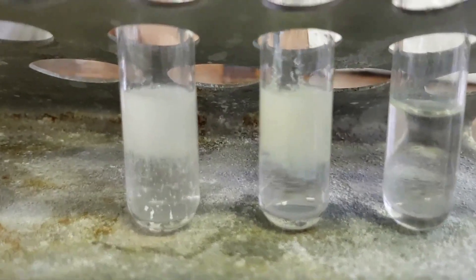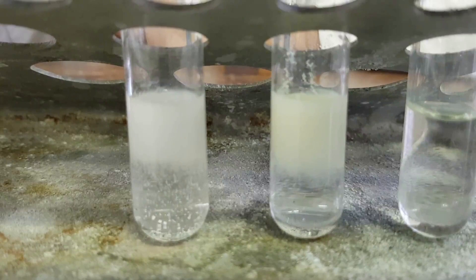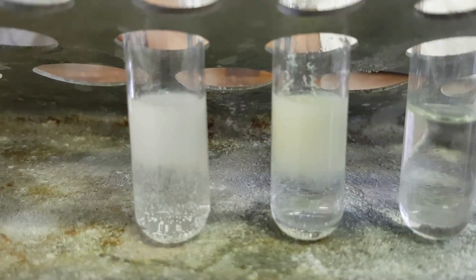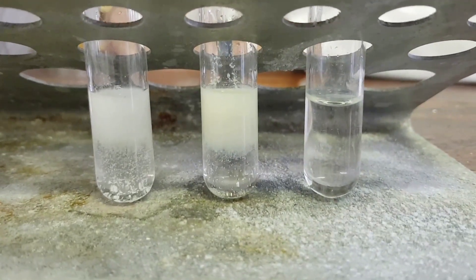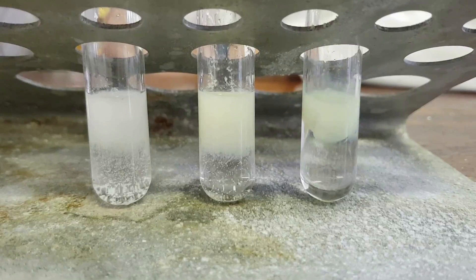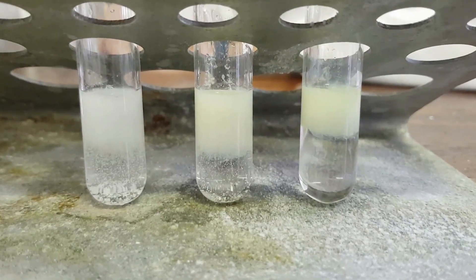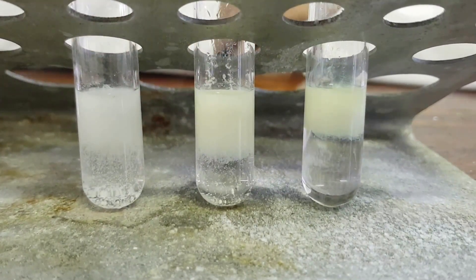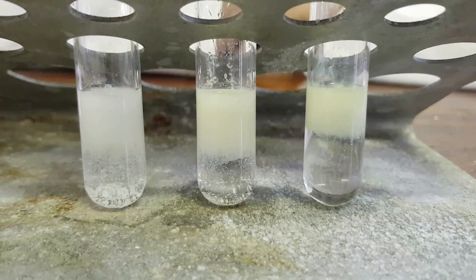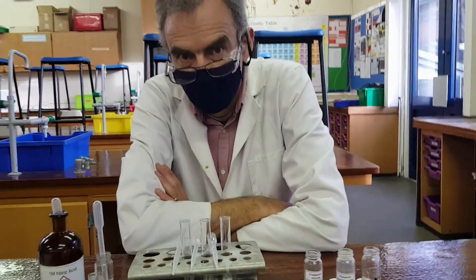Now for the bromide. When compared, it is obvious the bromide is a creamier colour. If you saw the bromide in isolation it would be quite difficult to distinguish from white, but next to the chloride the difference is obvious. Now for the iodide on the right — there is no mistaking that it is yellow. So silver nitrate with chloride gives white, bromide gives cream, iodide gives yellow. Thank you very much, Mr Reeves.